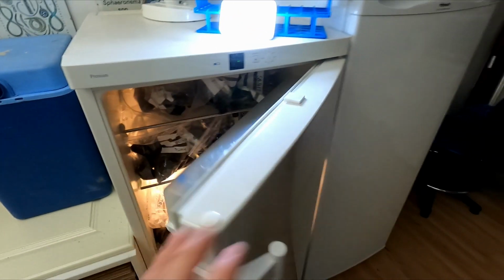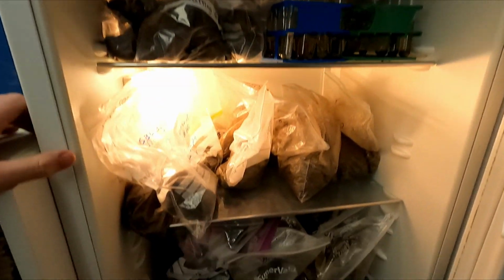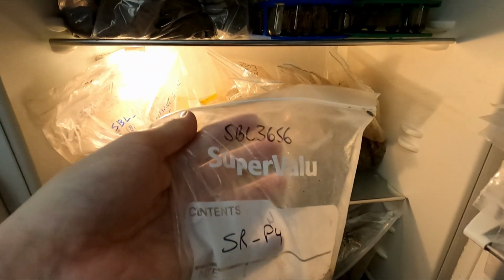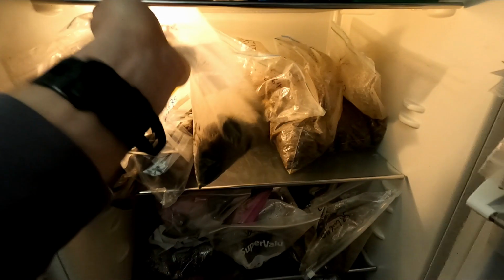Now, one of the reasons for this is one of our storage fridges. You can see all these bags of samples that we have in here, and if I just pick any one of them, look, you can see that it's pretty generic. This is our laboratory code, and unless there's some unique identifier, that's the customer's ID, it basically could just get lost.